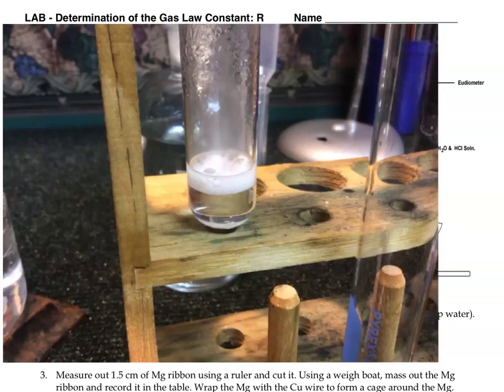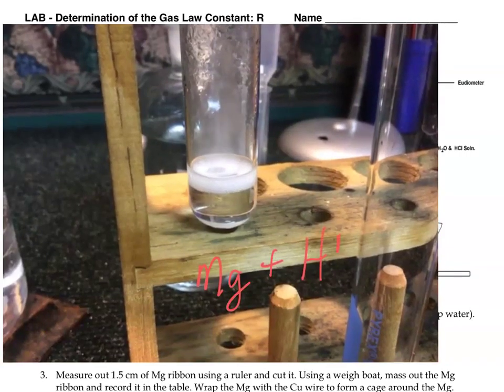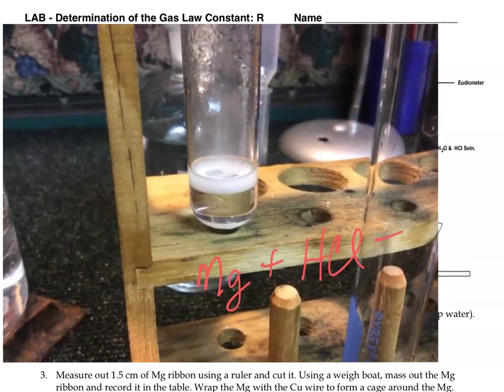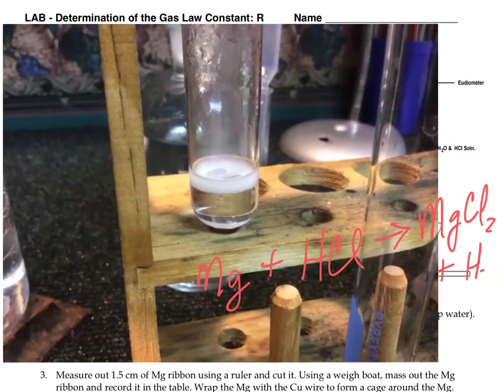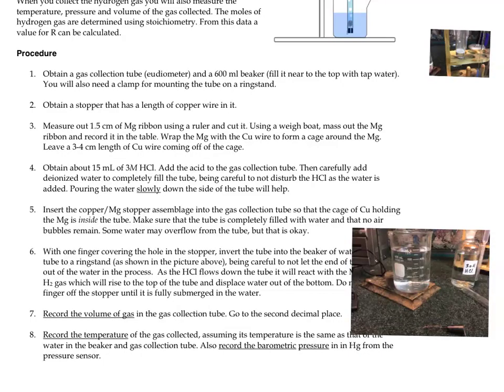All right, again, it's going to be magnesium plus hydrochloric acid, and that's going to give us magnesium chloride. That's going to stay aqueous, and hydrogen gas, which are these bubbles that just go right up out of the test tube here. Okay, next let's take a look at the procedure. Number 1, obtain a gas collection tube called a eudiometer and a 600 milliliter beaker filled with tap water.